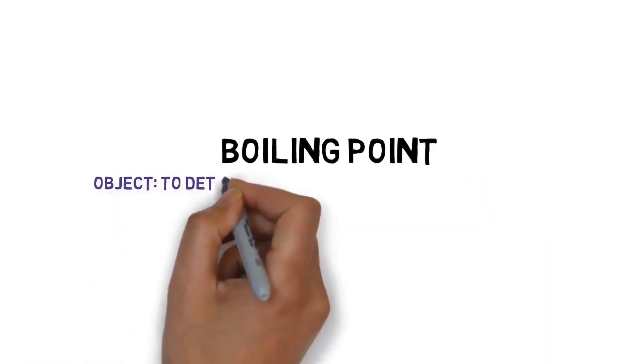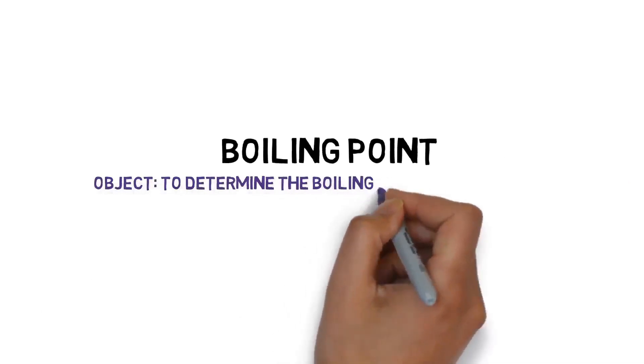To determine the boiling point of given liquid.